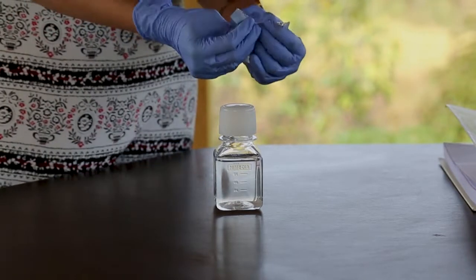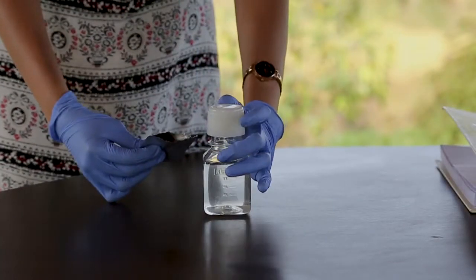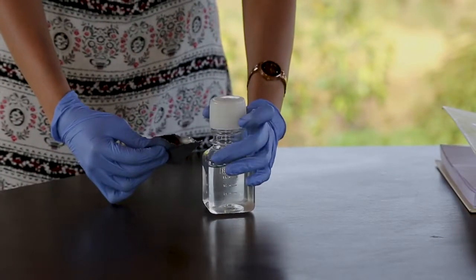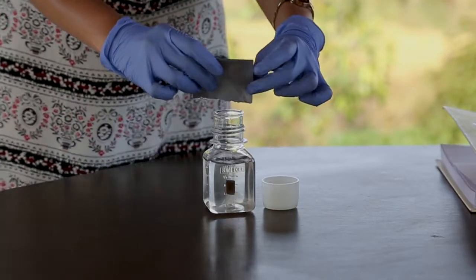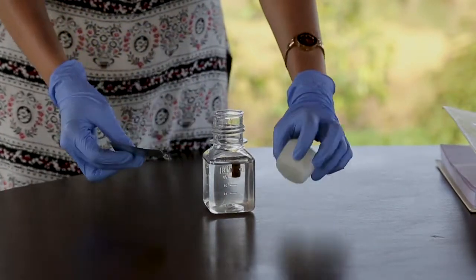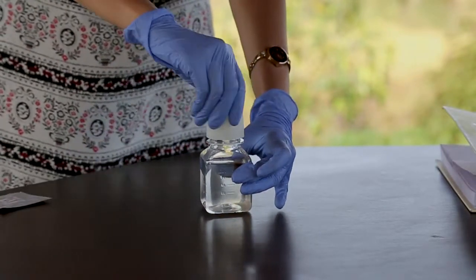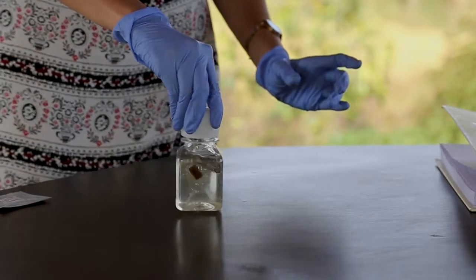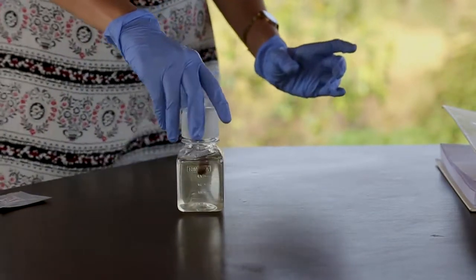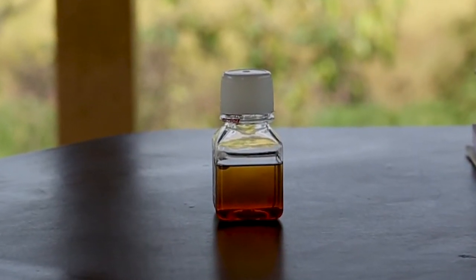Next, open the medium pouch, place the medium in the sample bottle, and put the lid back on the bottle. Don't touch the test buds with your hands or fingers. Mix the medium with the water sample by swirling the bottle periodically for about 15 minutes. The medium dissolves from the test bud. When the medium is completely dissolved, the carrier turns white or nearly white. The carrier itself doesn't dissolve.